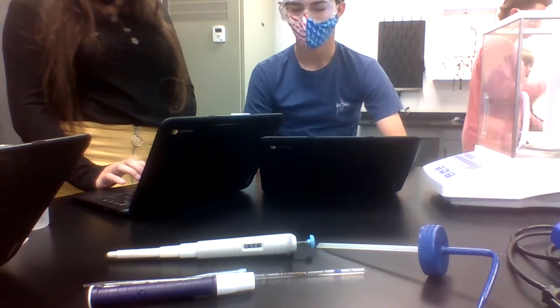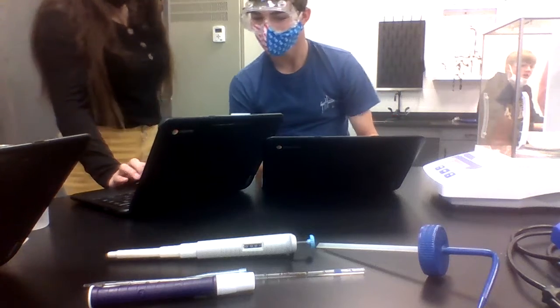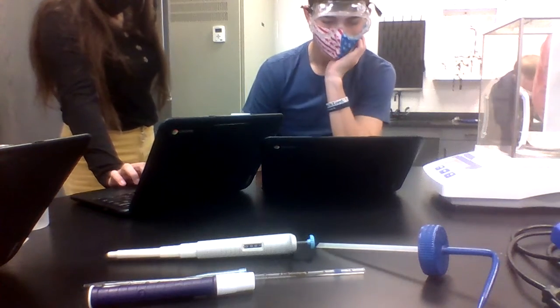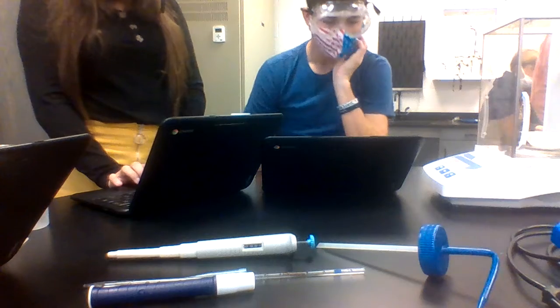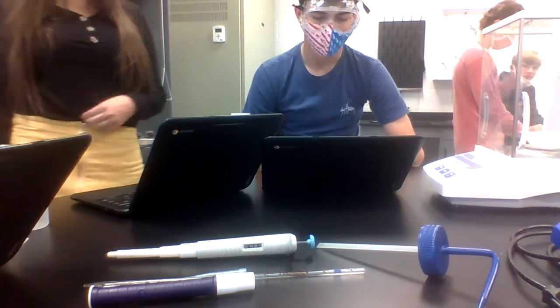Oh no. Just go to undo, and it will undo. Alright, so that's right. Do we do these now? The initial one is done, and then you'll do the same way you did it.